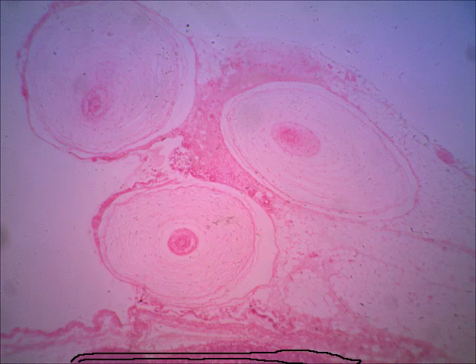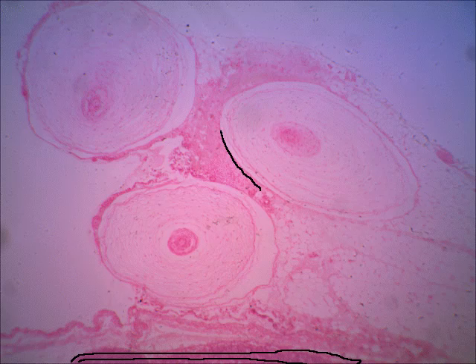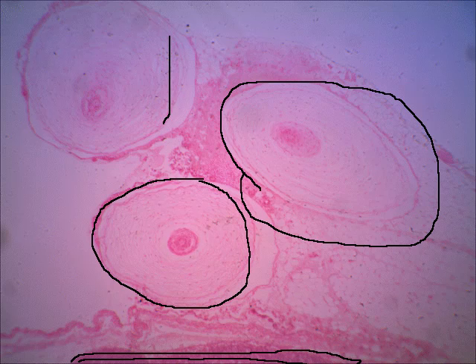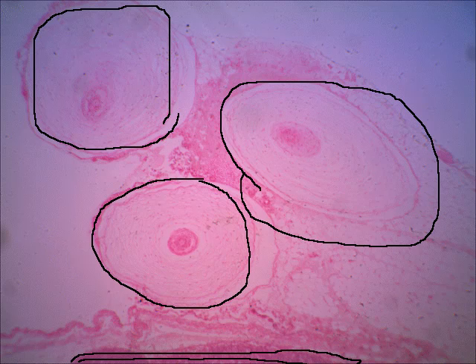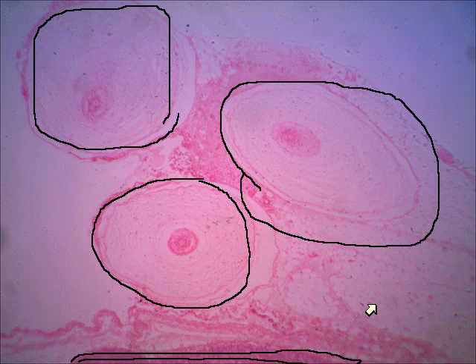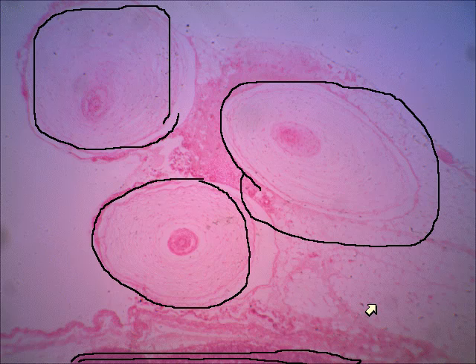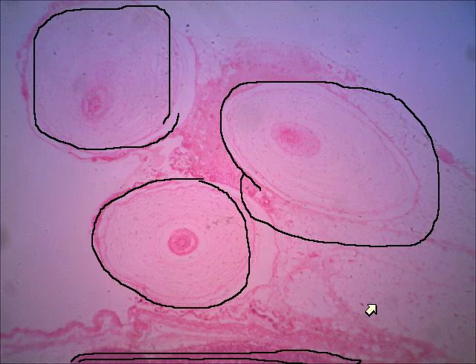Down here at the bottom of this slide is pancreatic tissue. We have three pacinian corpuscles — there's one, there's one, and here's the third. You might remember from A&P 1, you can also see some adipose tissue there. This is the last slide in these recordings for Exercise 30, but if you go to the other items in the slide folder, you'll see lots more — especially pacinian corpuscles — and you'll see some labeled skin that shows the Meissner's corpuscles. Make sure you study those.